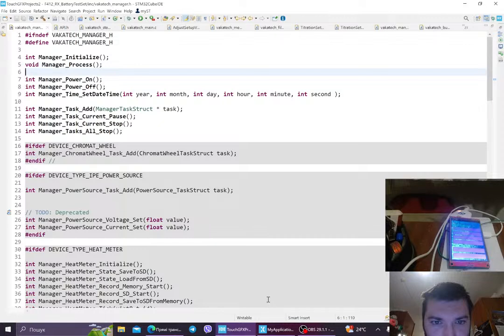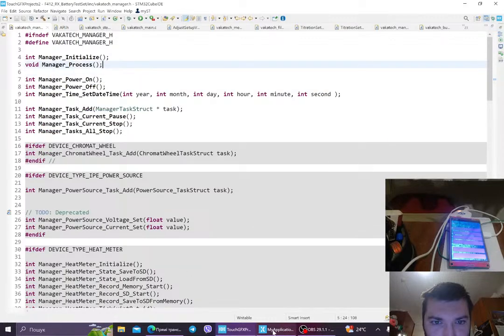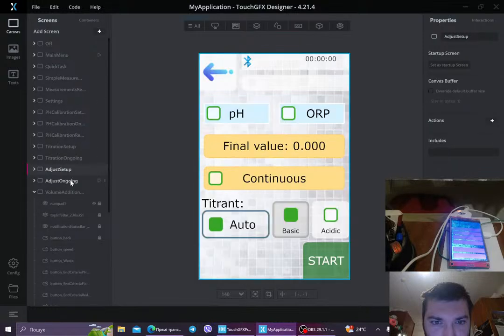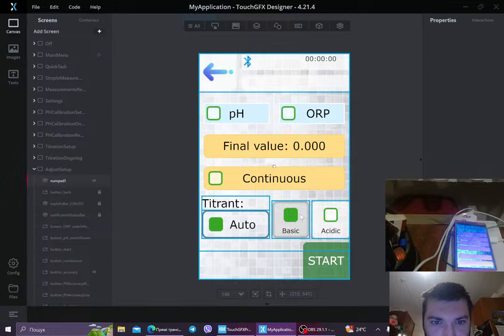So what is the task for today? Today's task is actually to finish the pH adjustment. Yeah, so we have here the adjust setup, adjust GUI. We had several problems here. So the first problem was that if the user... we didn't have this, this is just the most recent addition. So we had just pH or ORP, we had final value, and we had continuous. So what does each do, and what is this method for?